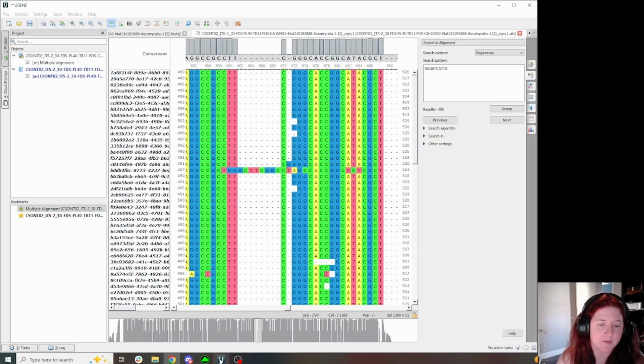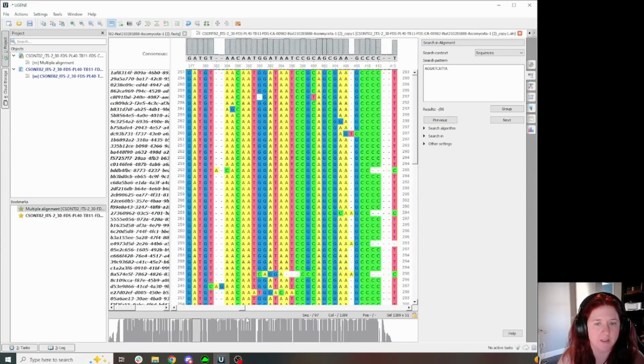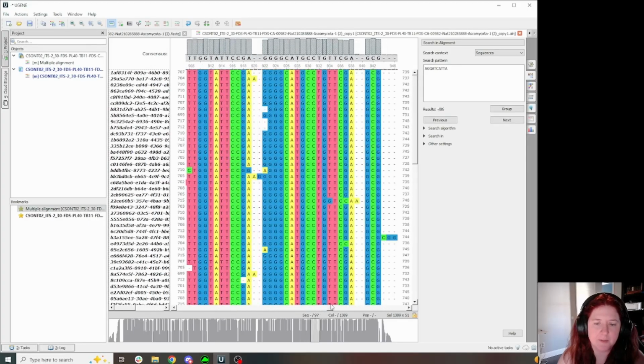But this is not the case here. When I open this FASTQ, it actually aligns pretty well. This is about as good as you're going to get. There's a little noise in there, but it's not too bad.